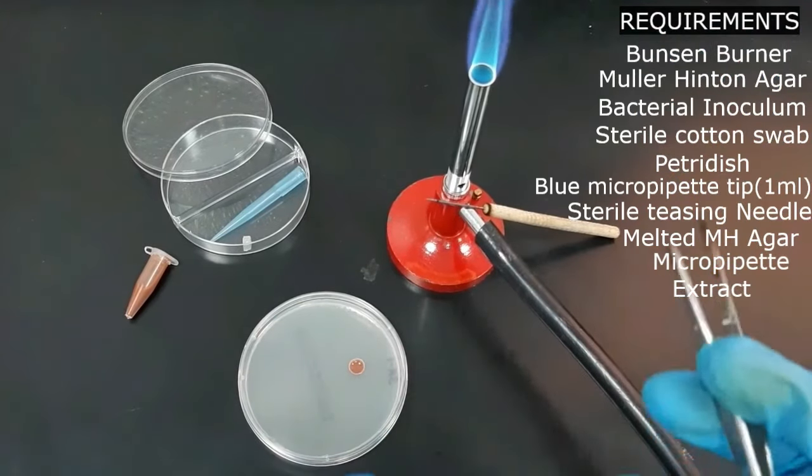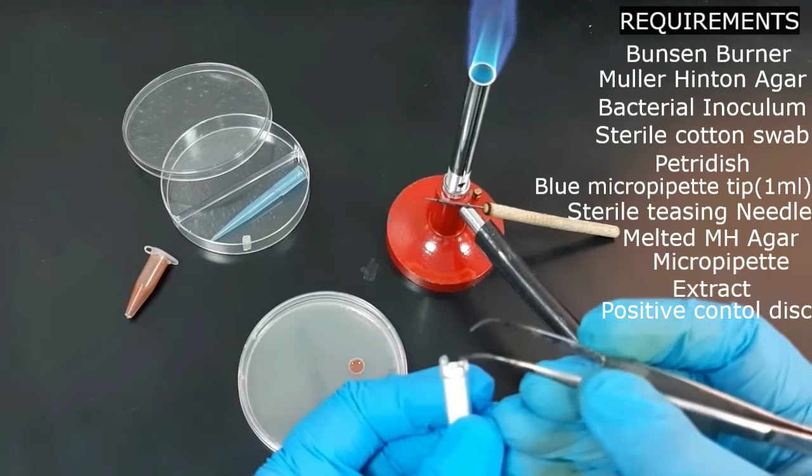After adding the extract to the well, add a positive control by placing the control disk on the plate.